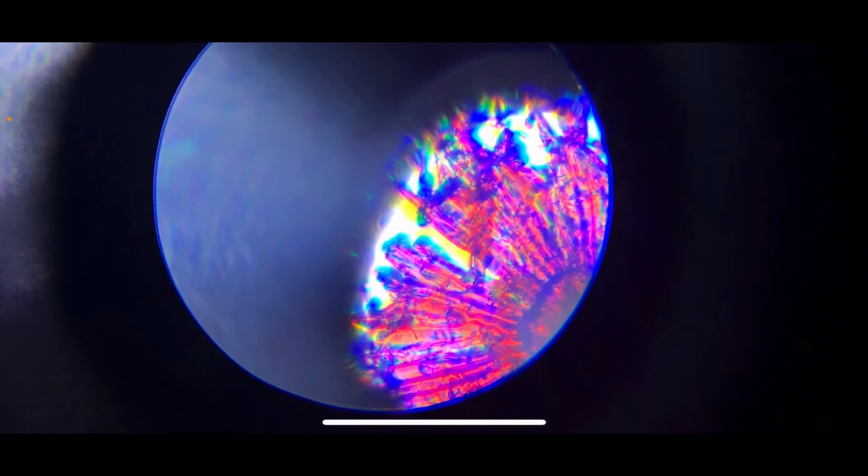Now let's look further. So we've got some really cool photos this time. This was the pink, I call it a flower, because it does look like a beautiful flower. But basically you can see how these structures, almost like orange pulps, are presented. You see that there are darker lines separating each pulp from another, and you can almost also see the center of the flower, which I don't know what it is at the moment. We can definitely get deeper into that.